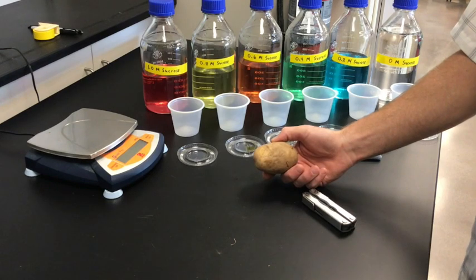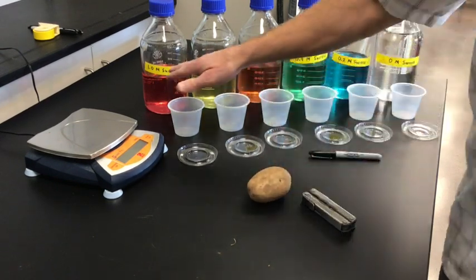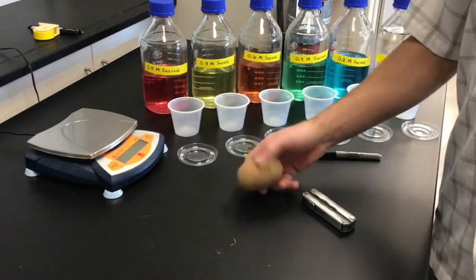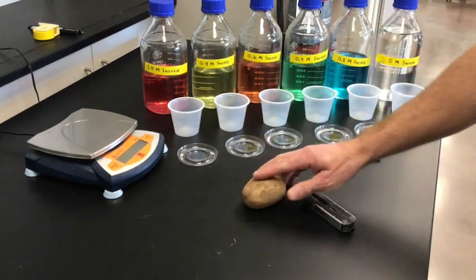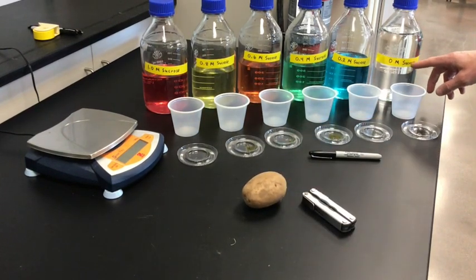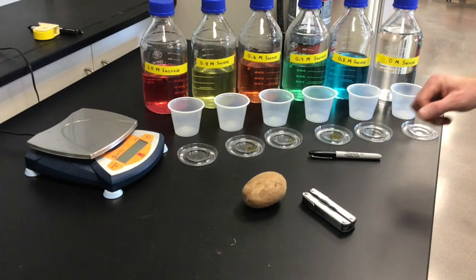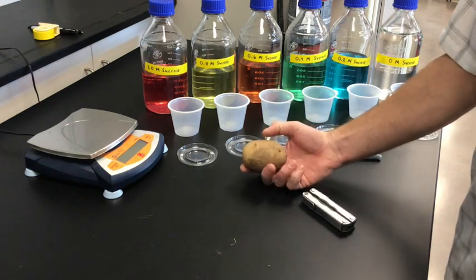If the potato chunks are placed in a hypertonic solution, such as the 1.0 molar sucrose probably is, then we'll notice that the chunks lose mass over time. If the potato cell is placed in a hypotonic solution — for example, the 0 molar sucrose, which is just purified water — then the potato cells would gain mass because water will move from a hypotonic solution to a hypertonic solution.